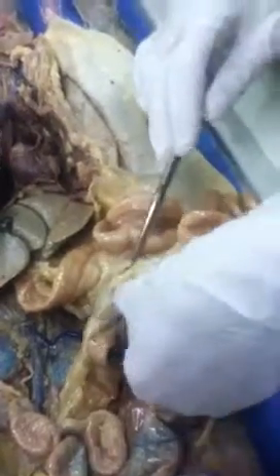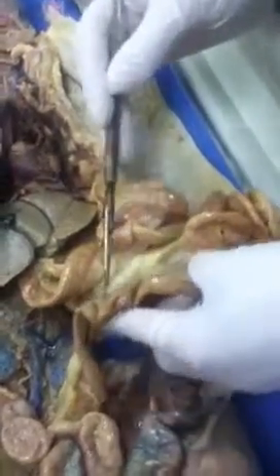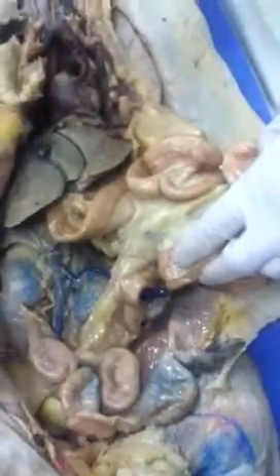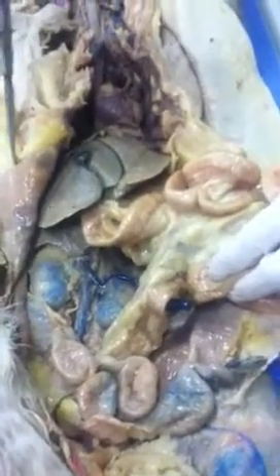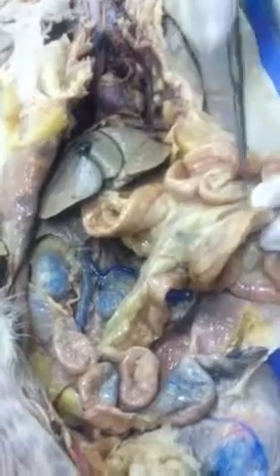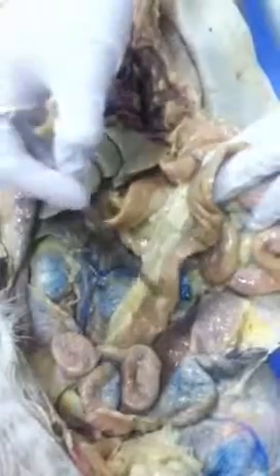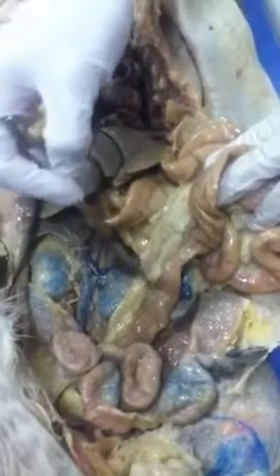So, okay. So then we have the large intestines, which in the human, the large intestines, remember, kind of goes up, ascending colon, across transverse colon, and down descending. The cat doesn't do that. So if I just tag here, I just want large intestines.